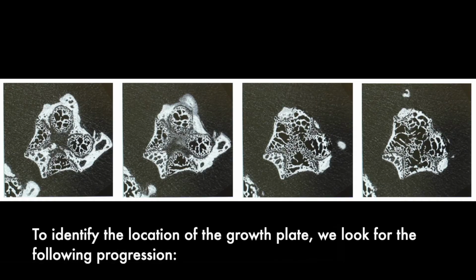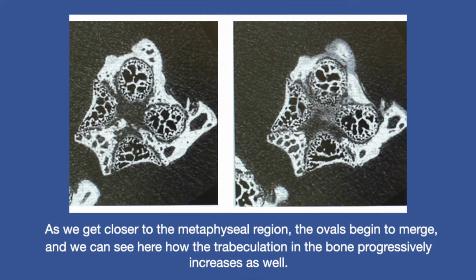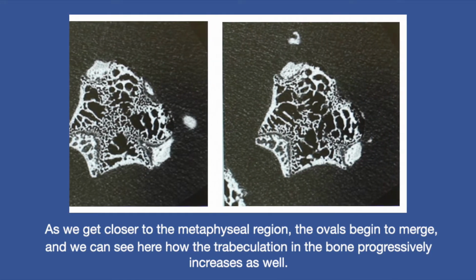To do so, we look for the following progression. As can be seen here, the growth plate can be recognized by the 4 ovals that constitute the crown of the plate. As we get closer to the metaphyseal region, the ovals begin to merge, and we can see here how the trabeculation in the bone progressively increases as well.